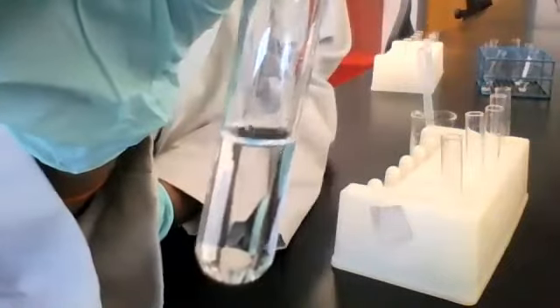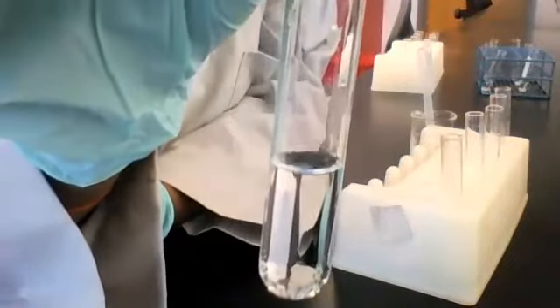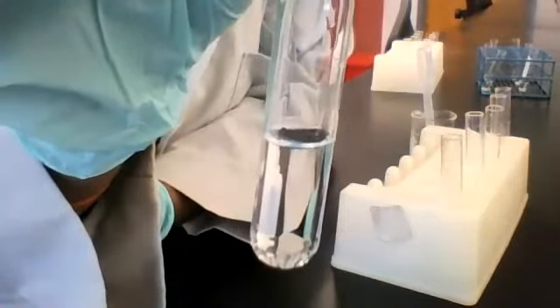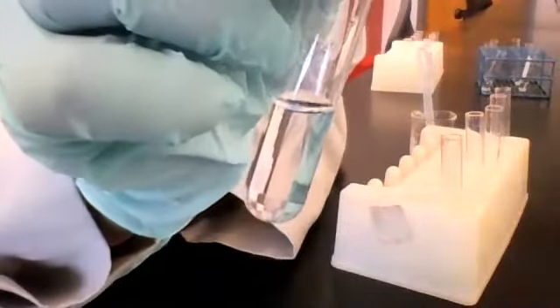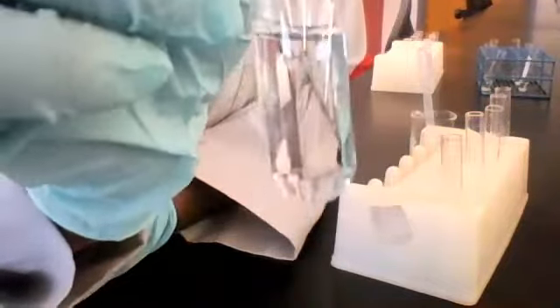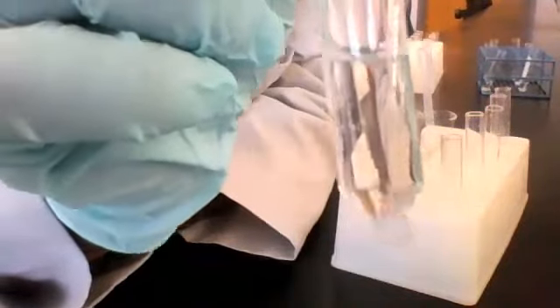All right, I don't see anything. Do you all see anything? No. Nope, no change here. Don't worry, I'm always checking for other changes. If I perceive a scent, or if I see any bubbling or anything like that, I'll let you know. But from where I'm standing, no change here either.